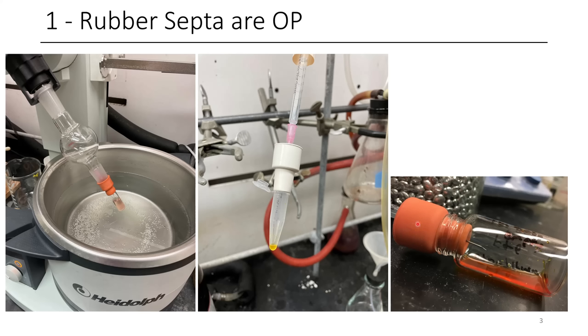Here you can see an example of an oil being high vac carefully on its side. However, I would always recommend that you high vac with a three fingered clamp so that your vial doesn't fall over and you don't suck any of your stuff up into the vacuum line.